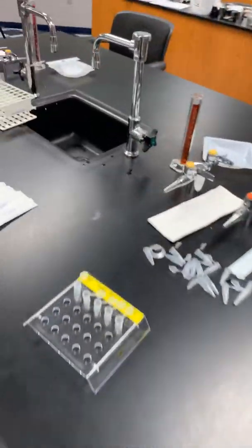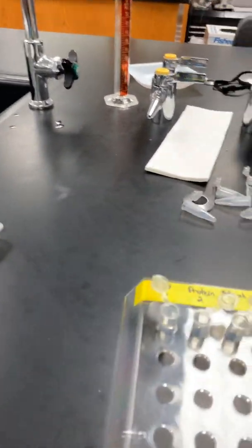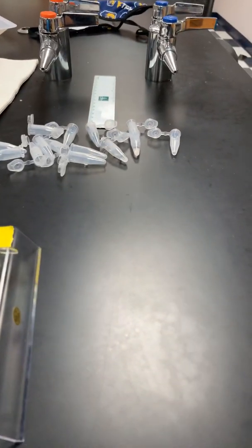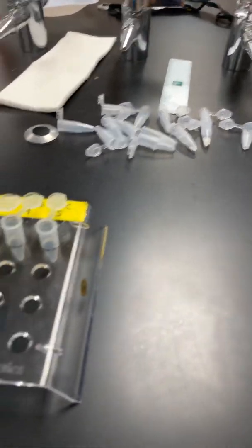So again, that's the transfer pipette. In the quantitative part, we're going to use these other pipettes. I'll talk about them later. But right now, you're going to use the transfer pipettes for this qualitative analysis. So once you have all 5 of your tubes full, water, protein, starch, lipid, vitamin C, you're going to add the rest of these 15 tubes to your rack.